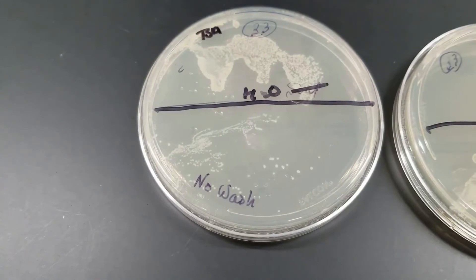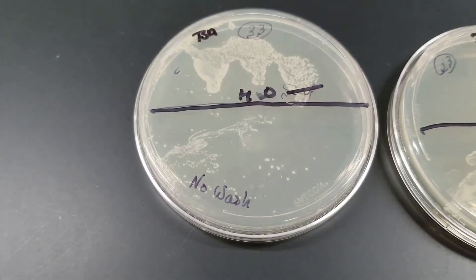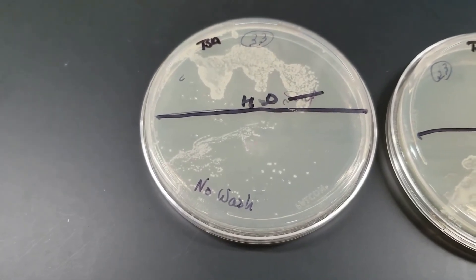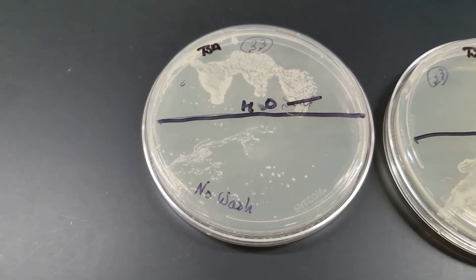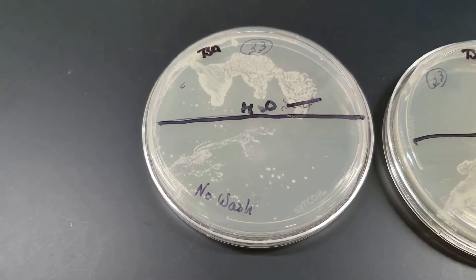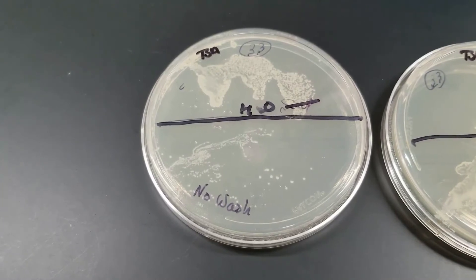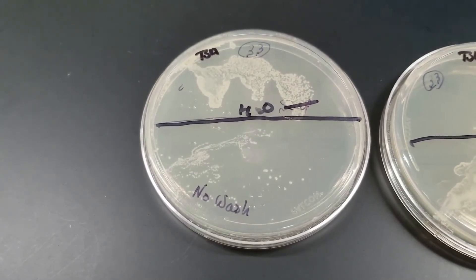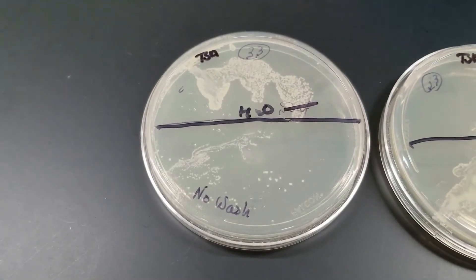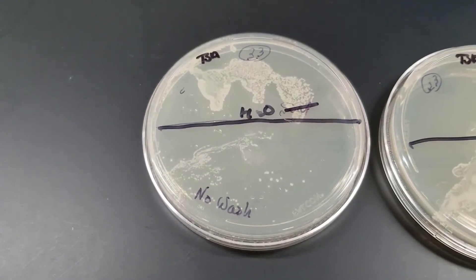Up here in the top half, this is where I just rinsed with water — no soap, just rinsed with water. You'll notice there's much higher growth there on my fingers. Something that could explain this is that I had to turn on the water with my hands; it's not a foot-activated faucet. So I'm not sure when the last time the faucet handles were cleaned, and I could have picked up organisms from there.